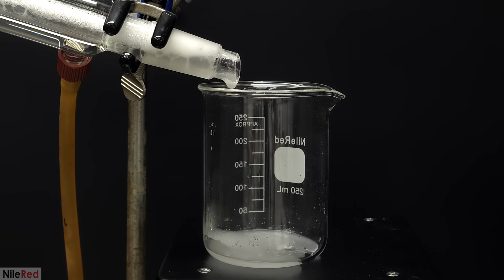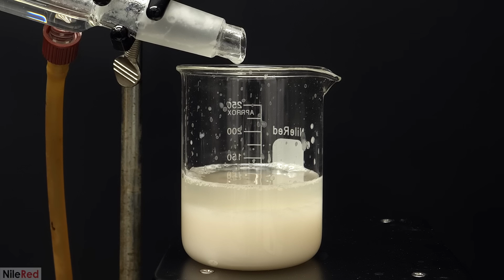This run was definitely turning out to be way messier than I expected. I was hoping that this stuff would be nice and clear, but that obviously wasn't the case, and I was going to have to recycle this as well. It wasn't a total loss or anything though, because the alcohol coming over was definitely a lot more concentrated than it started at. It just didn't look very nice. However, it was still mostly just water, and it had other volatile stuff mixed in as well. To really clean it up and to properly concentrate it, I'd have to do a second or maybe even a third distillation.